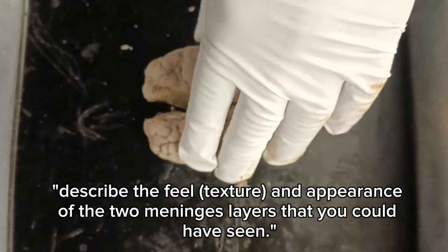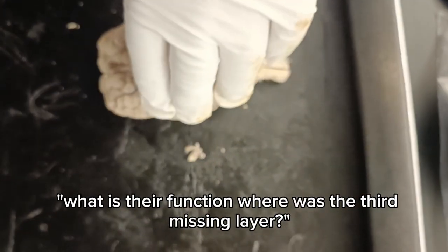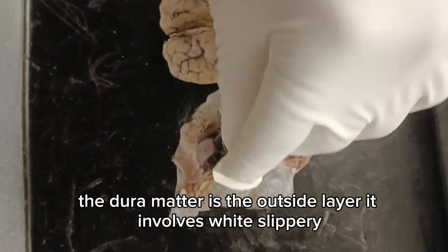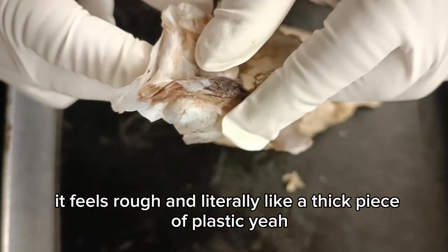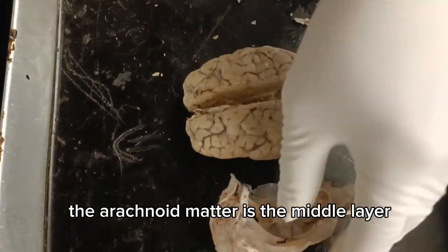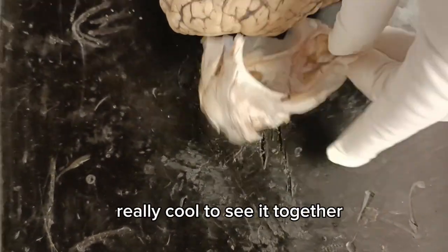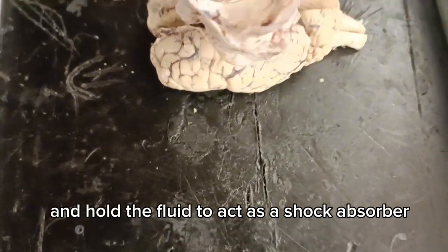Describe the feel, texture, and appearance of the two meninges layers that you could have seen. What is their function? What was the third missing layer? Alright. The dura mater is the outside layer. It is silvery white and feels rough and leathery like a thick piece of plastic. Yeah, this really does feel kind of fake. Anyways, the arachnoid mater is the middle layer. It looks like a thin, clear film or a spider web. Really cool to see it. Together, these layers protect the brain and hold the fluid to act as a shock absorber.